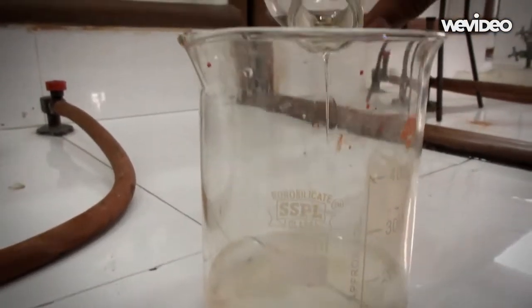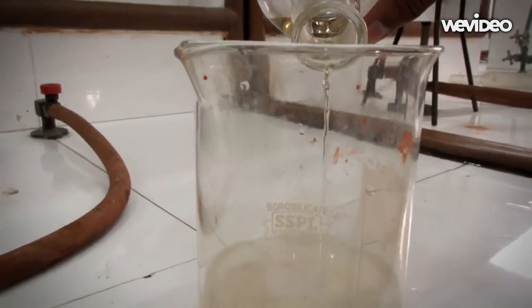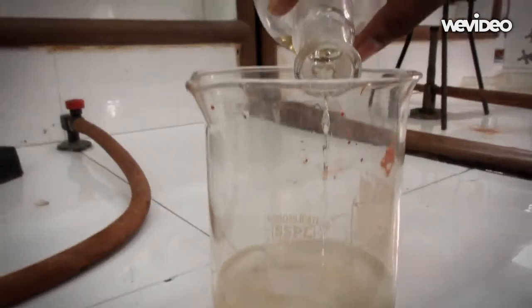Add them to a beaker of ice-cold water, and just like before, crystals of impure acetanilide are obtained.